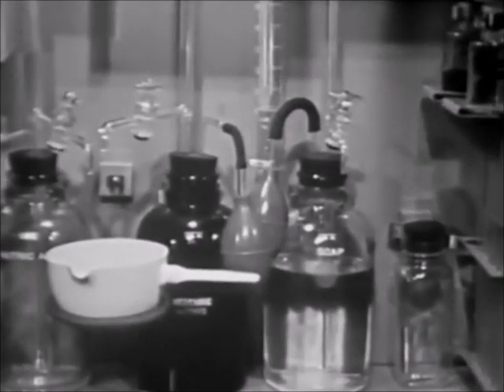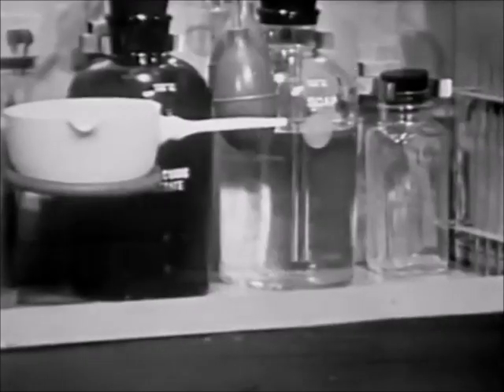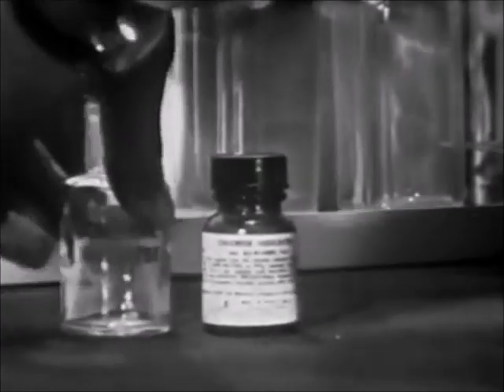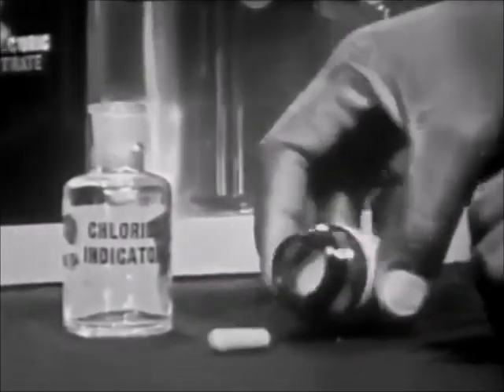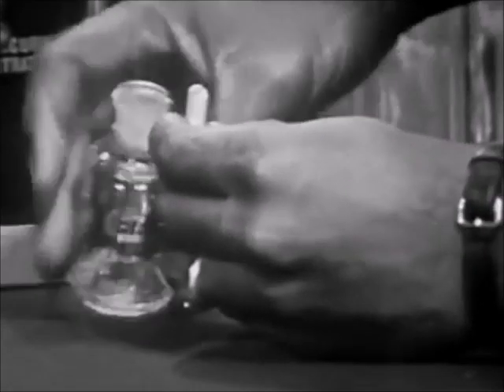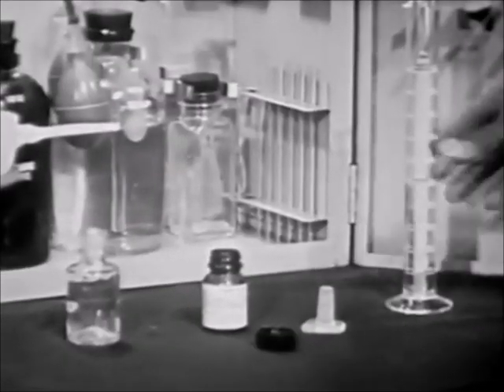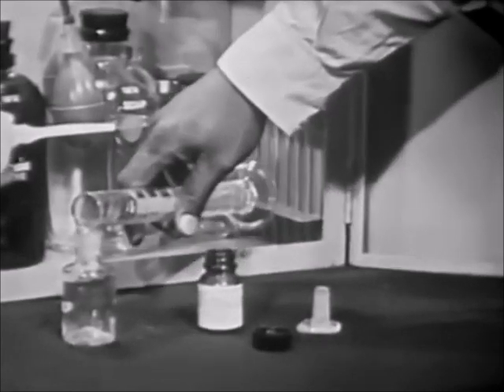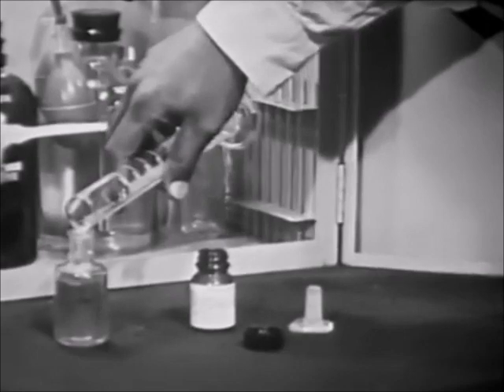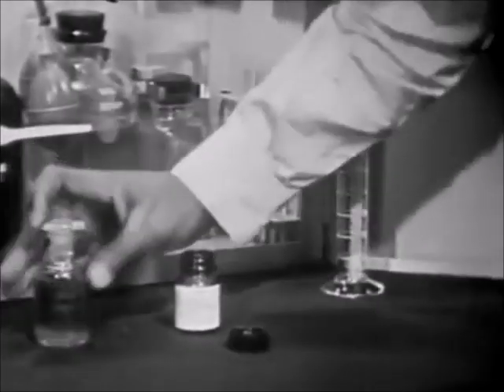First, prepare the three reagents used in the test: chloride indicator, nitric acid, and mercuric nitrate. Chloride indicator is stocked in capsule form to prevent deterioration. To prepare the chloride indicator, empty the contents of a single capsule into the chloride indicator dropping bottle. Next, add 50 milliliters of 95% ethyl alcohol or isopropyl alcohol. Place the stopper in the bottle and shake to dissolve the contents.